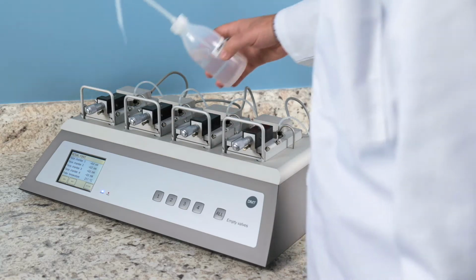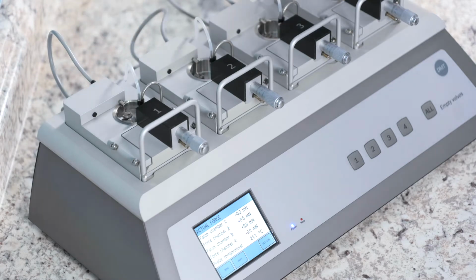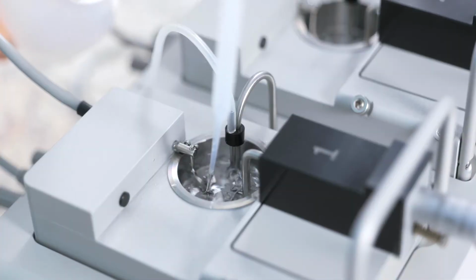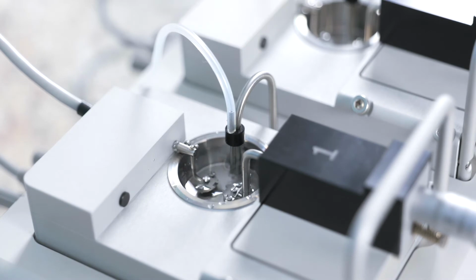Then take distilled water, fill your chamber 3 times, and empty it. You will do this 3 times and empty the chambers.